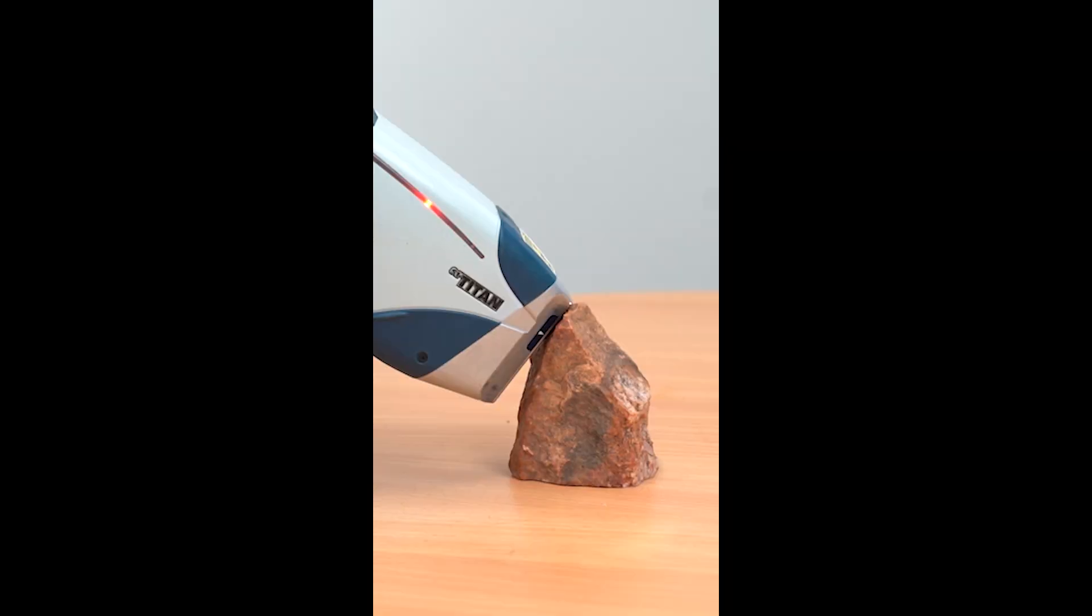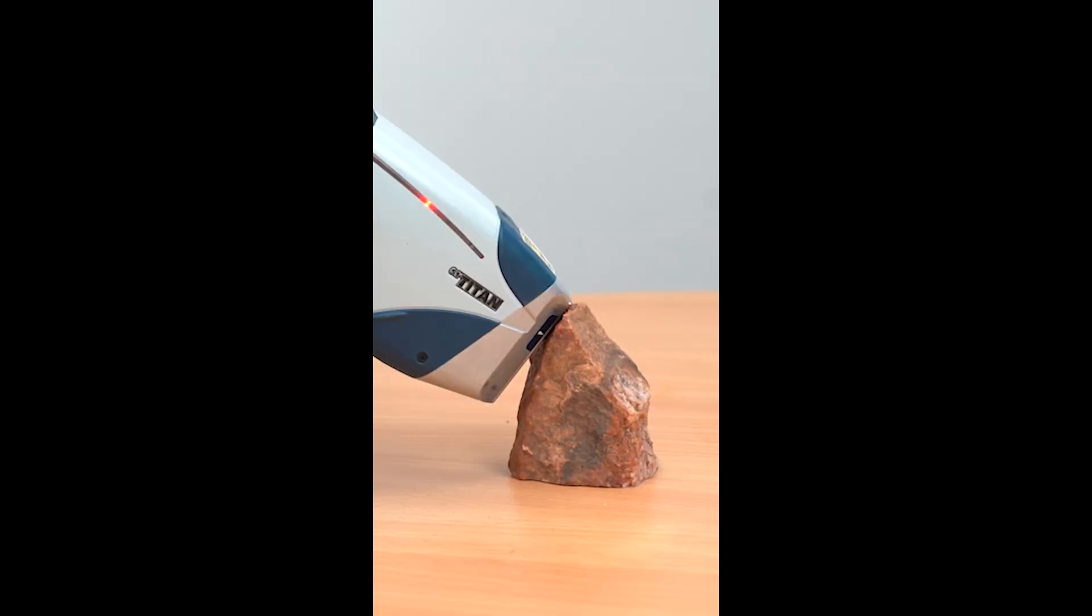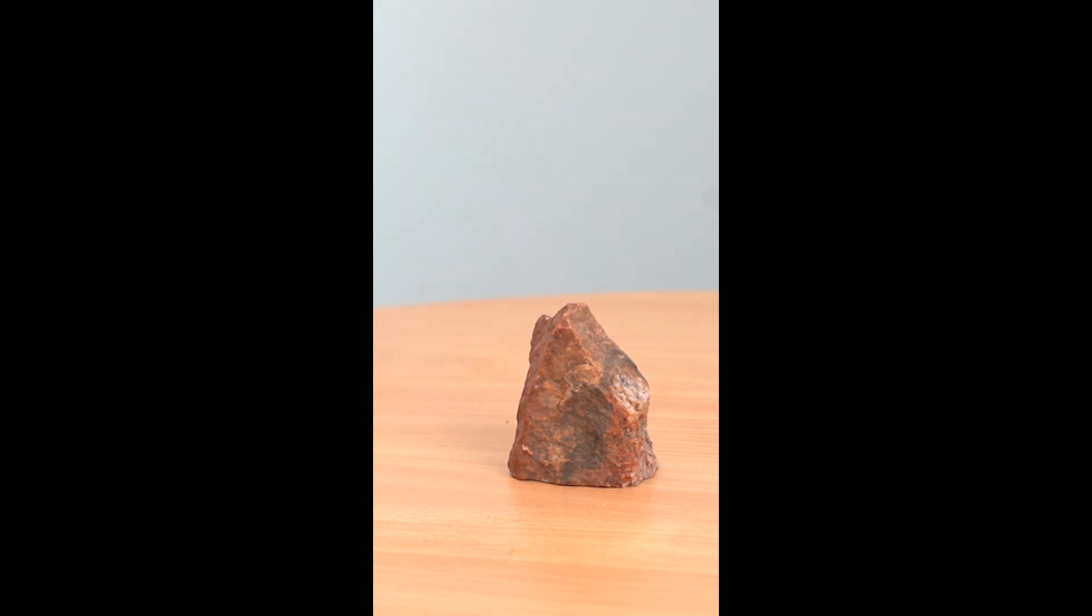If this is not possible, hold the instrument just above to not pierce the window. But be aware that the quality of your data will be reduced due to the gap between the instrument and the scanned area.